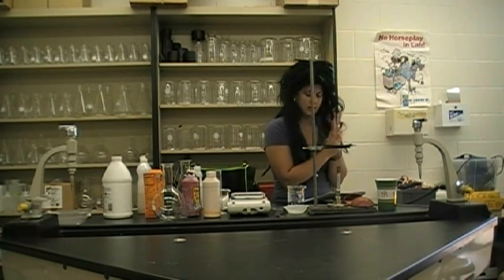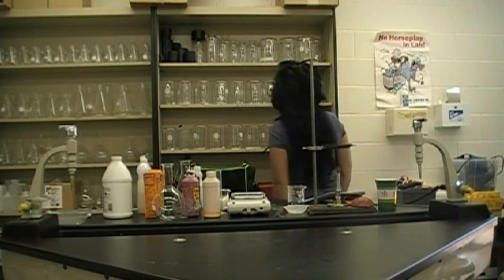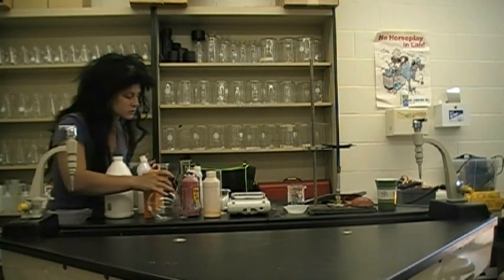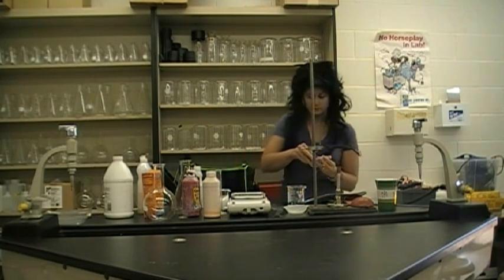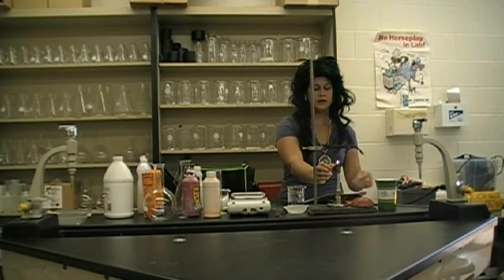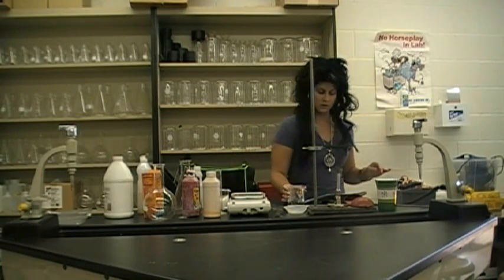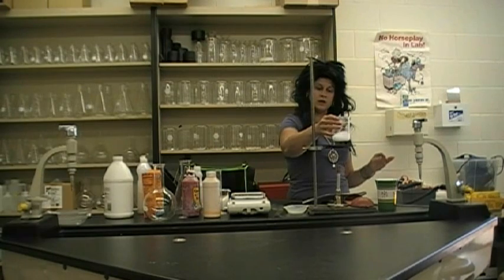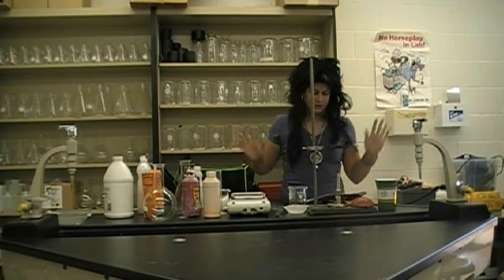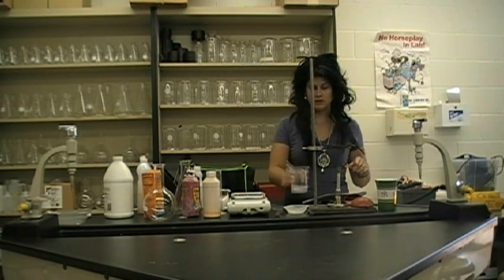I'm going to turn on the gas. Ooh, the matches — there are the matches. Okay, just adjust it, that looks good. Heat this up — ouch, that's really hot! Okay, let's not do that again. I think I'll just set it here for now.